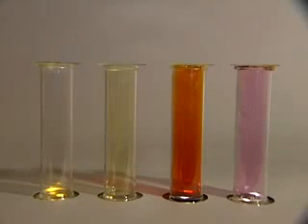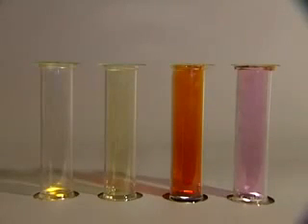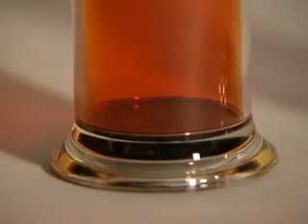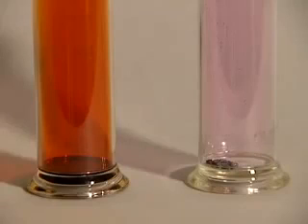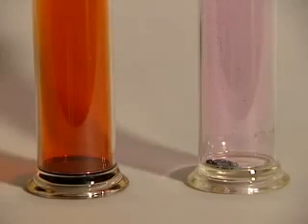Here are the four halogen elements: fluorine, chlorine, bromine and iodine. Fluorine on the left is almost colourless. Next comes chlorine, which is greenish-yellow. Fluorine and chlorine are both gases at room temperature. But bromine is a liquid and iodine is a solid. Even so, they're both quite volatile. You can see the coloured vapours — orange-red above the liquid bromine and purple above the solid iodine.